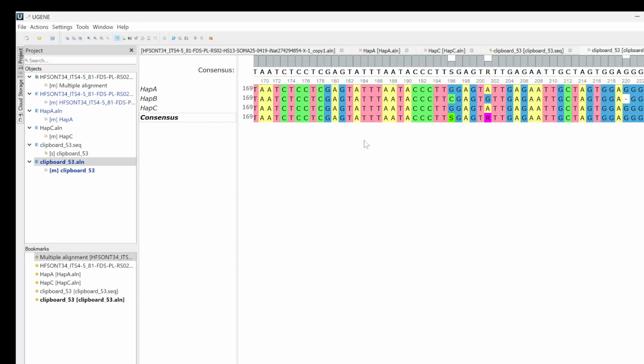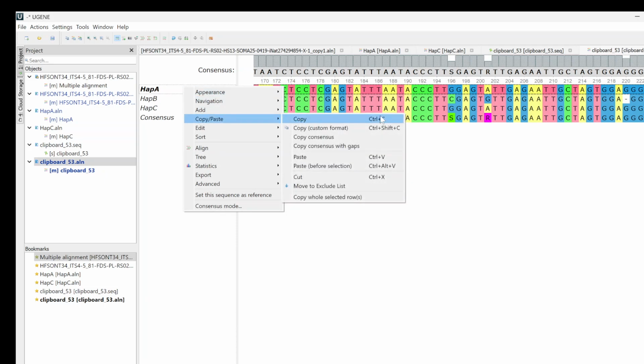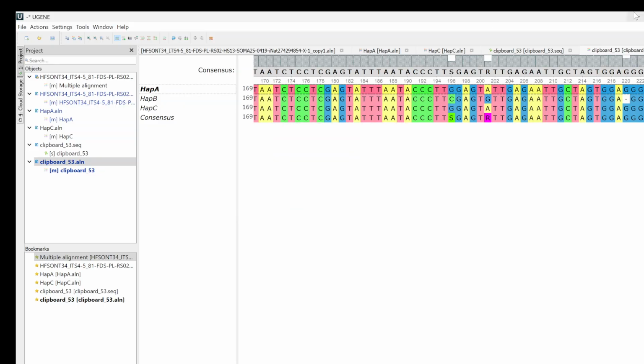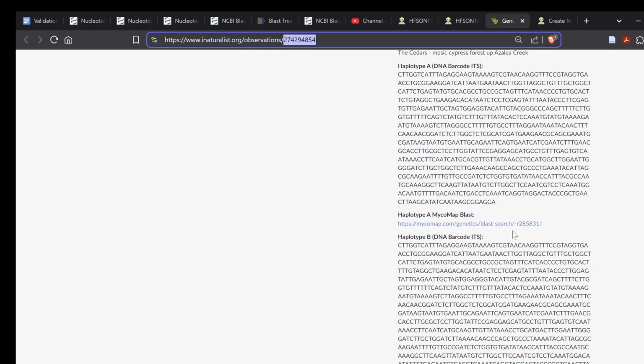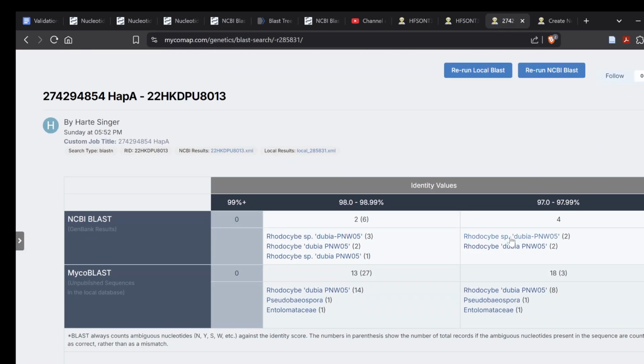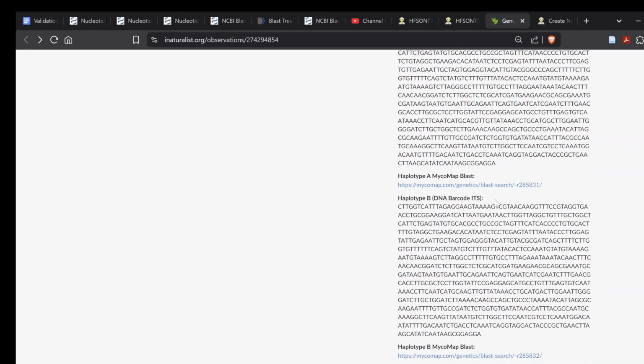And you'll go into UGENE, and you'll get your Hap A, and you'll just copy. You can do Control-C for that. Just regular old copy. And then you'll go and you'll paste it in here. And you'll put whatever results, and you'll save it. And after you save it, you get a URL, just like the one I just clicked on here. And you'll put that under haplotype A DNA barcode ITS. That way you have a link to that, you've got the sequence for haplotype A, and you just rinse and repeat.